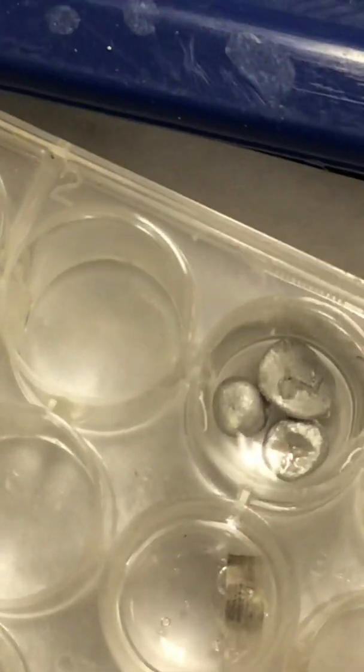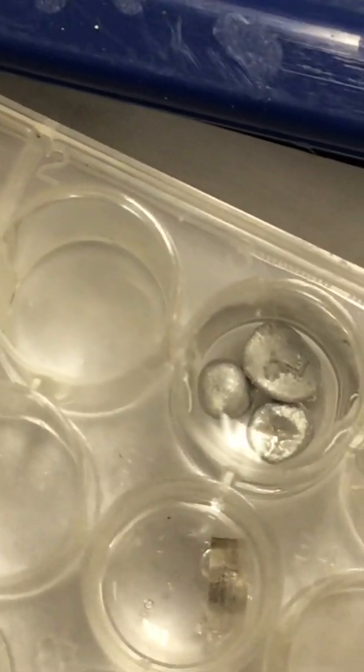Oh, I saw a bubble. I saw a bubble. Yep, there's a bubble. There was another bubble. Ms. Castro framed it for you. Yeah, they're starting to come off that top piece, the one that's to the right. Okay, there's some on the bottom, yep. Right there. Oh, I just saw one escape. Okay. So now we got all of our data in our table.